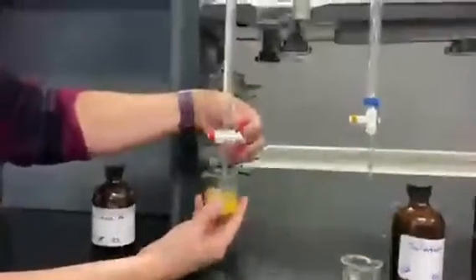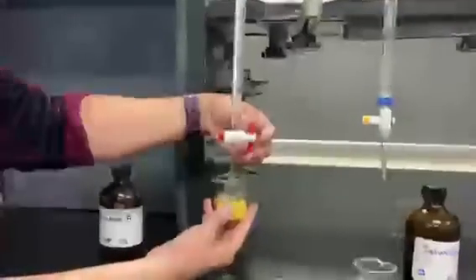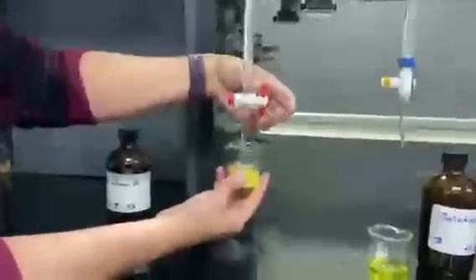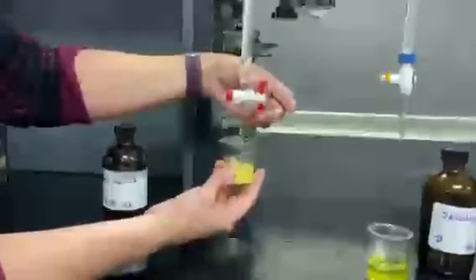So I'm going to add it. Again, usually I want to do it drop-wise, and I'll swirl. I'm trying to make it so you can see what I'm doing here. It's just going in drop-wise. Okay, I am getting the brown color, but it has to stay. We expect this brown color to remain, not the yellow, the brown. So it's like this cloudy, you get little splashes of brown in it.